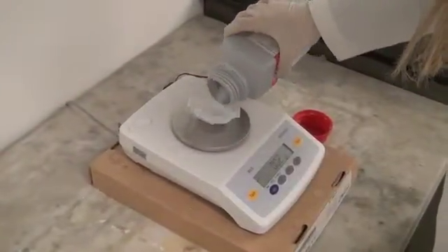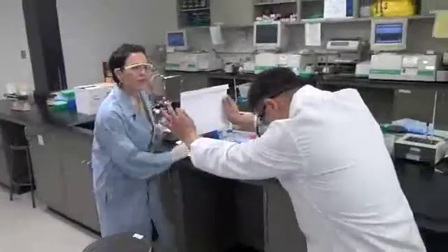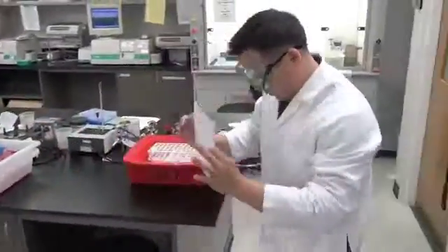That's correct, Dr. Beckman. Looks like Challenger Kurate is taking a hint and weighing out her salt for her 40% step as well. Ahaha, she should be using a spatula, and not her finger. It appears that the assay team has confirmed activity for Biochemist Dicer, and now she is ready to proceed.